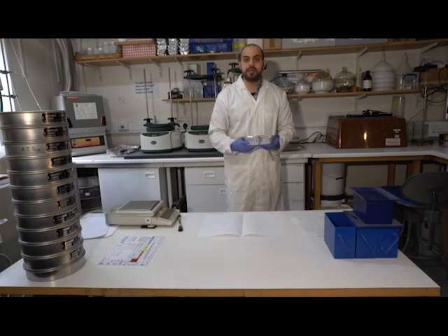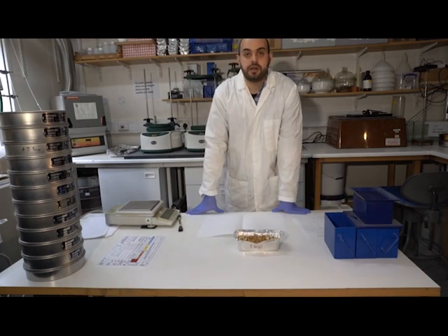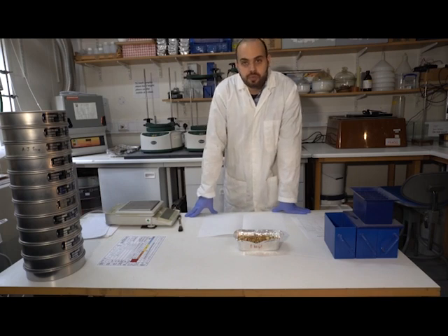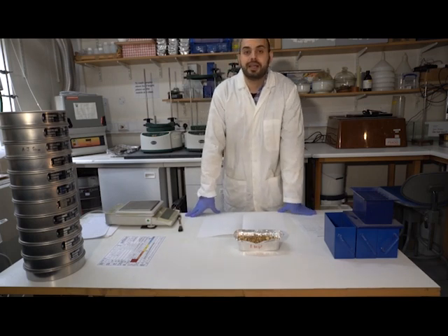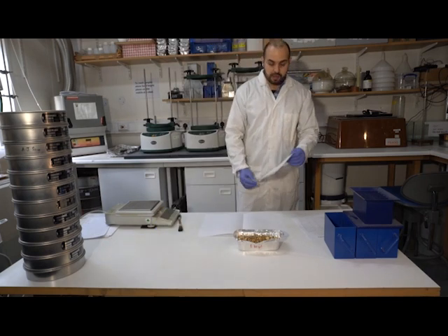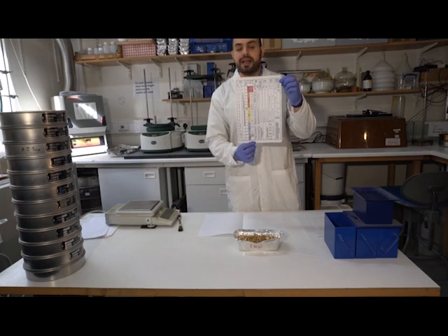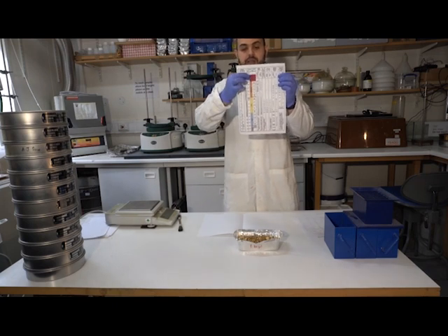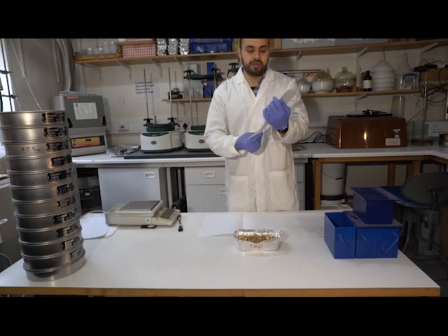Sands and gravels are really defined based on their particle size. Sand pertains to any particles that are bigger than 63 micrometers in diameter and up to 2 millimeters, beyond which we classify particles as gravel. So anything from 2 millimeters and upwards, we classify as gravel. This distinction between particle sizes is known as the Wentworth-Udden scale, and I've got a copy here, which you can download from Wikipedia, a pretty good graph. It distinguishes different classes of sediments. We've got clays and silts, the very fine particles, and then sands, pebbles, and then cobbles or boulders. And this distinction here is at the 63 micron mesh.